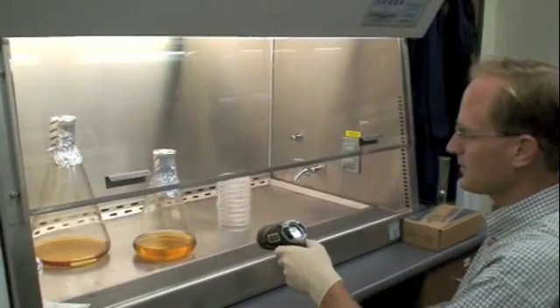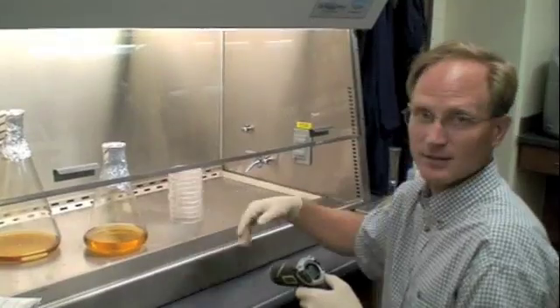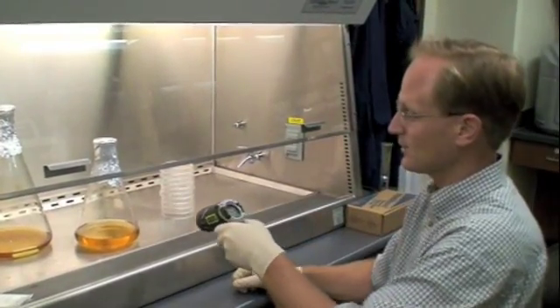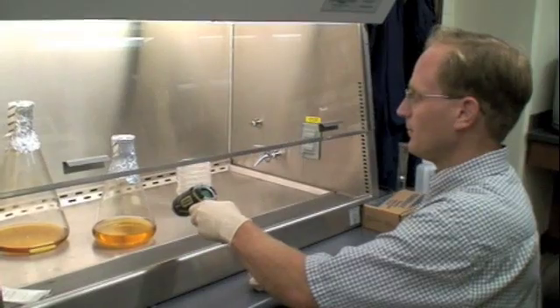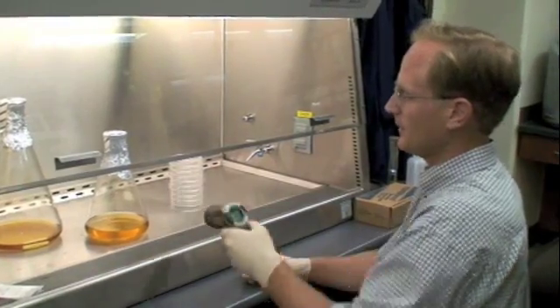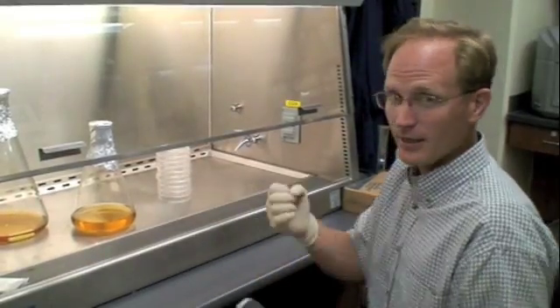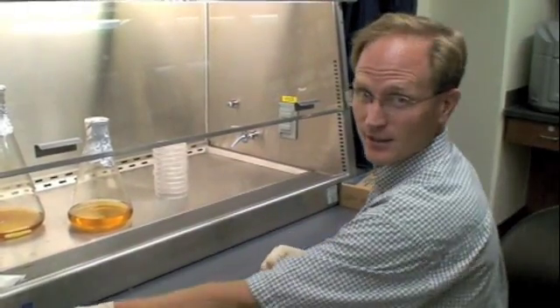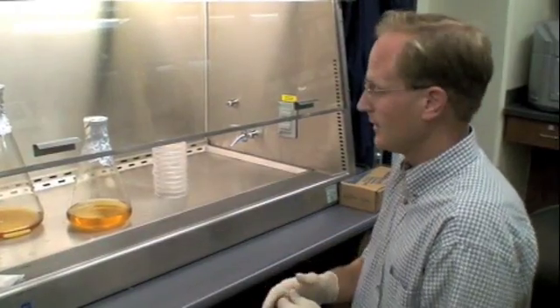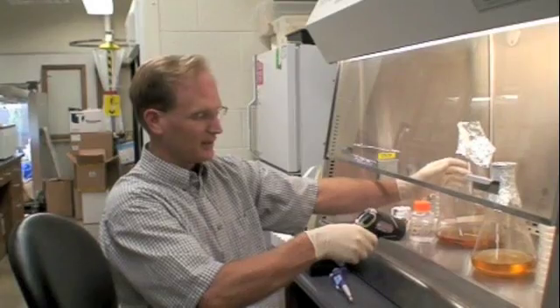Now, this is a laser thermometer, so be careful because the laser bounces off these stainless steel sides. So try not to shine it in your eyes. But it does a fairly good job. So this is now at 46 degrees Celsius. Right at about 30 or so, it'll start to set up. So I need to get my IPTG, X-GAL, and my ampicillin in there before it gets too late. And now is a good time to do that. It's at 43.